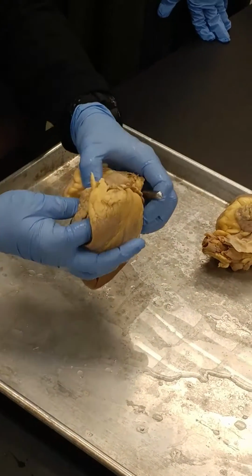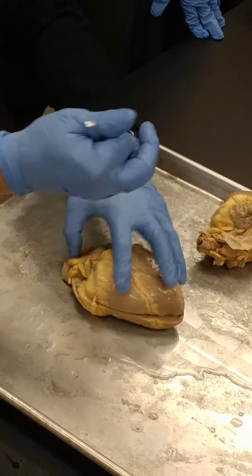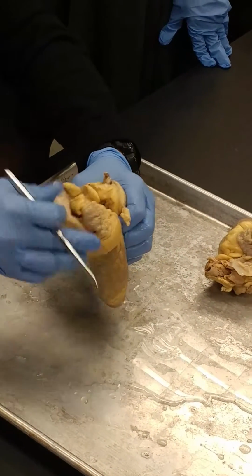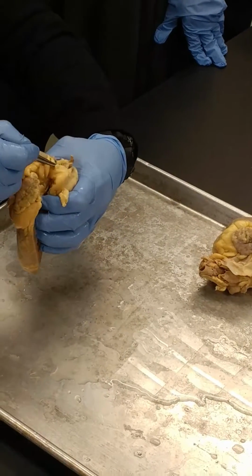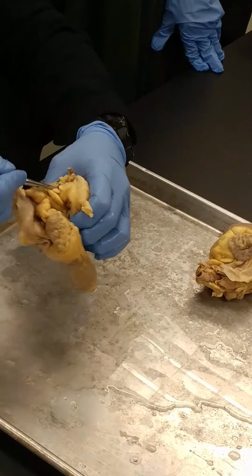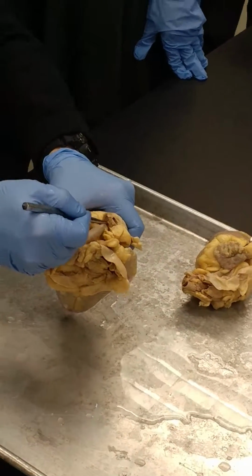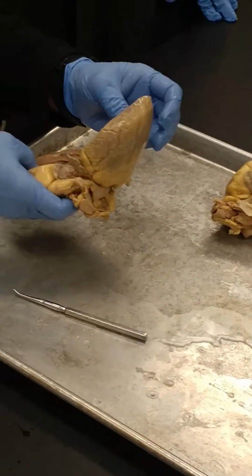And let me pull my finger out so you can kind of see. Now, not all of you can be able to see this. Probably Kristen and maybe Susanna would be best to be able to see this. But the valve cusps are these little dudes right here. Hard to see them. I know you can't see them over on that side. But they're going to sit down in here. We'll see if we can show you a better shot of, let's say, well, let's just do it now.